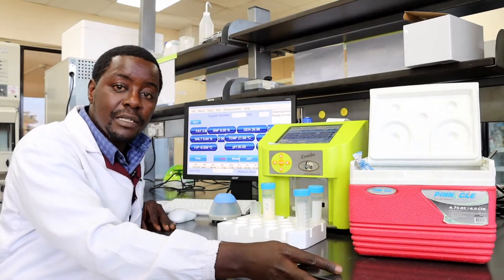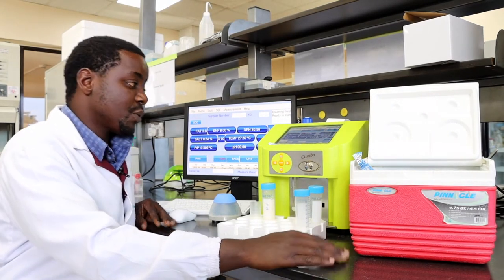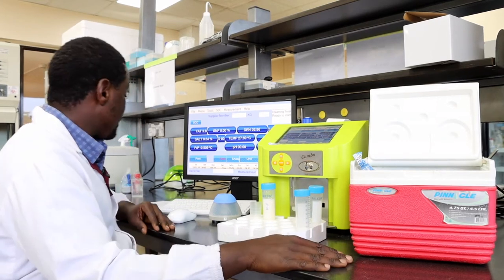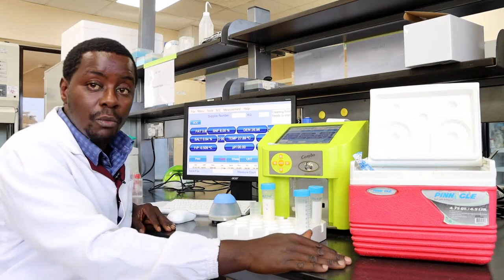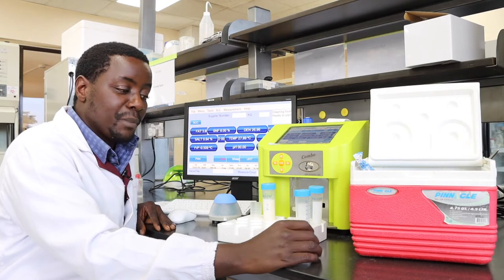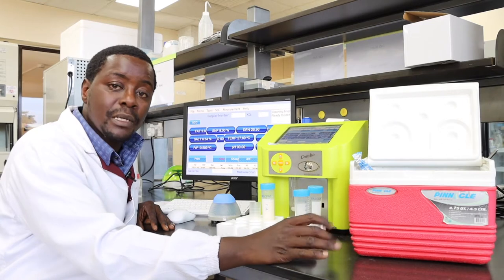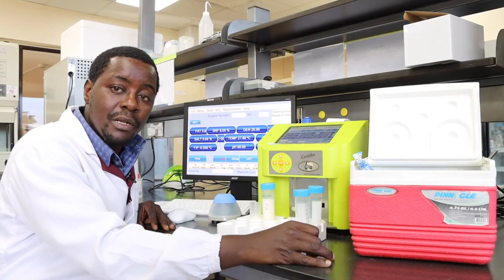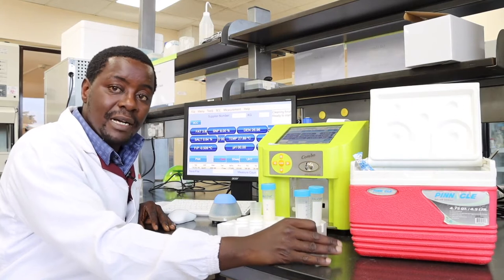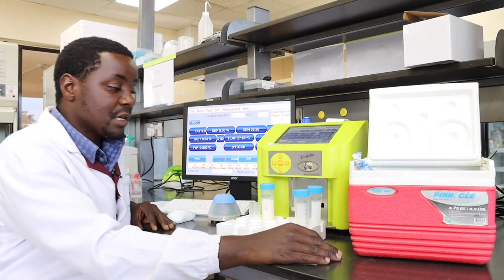Welcome to the third part of this instructional video. I'm going to take you through the milk chemical composition analysis using the LactoScan Combo milk analyzer. When performing your milk sample analysis, there are three major steps to bear in mind: the first is how you're going to prepare your sample, the second is performing the analysis, and the third is data extraction or visualization.